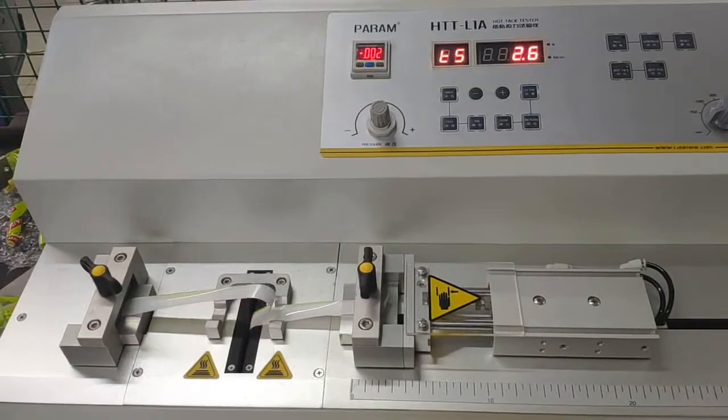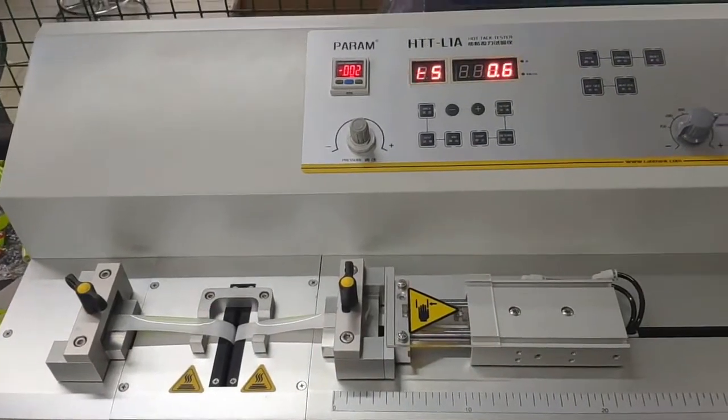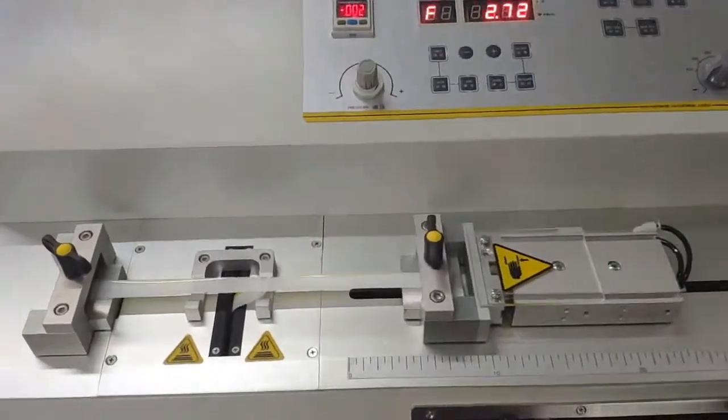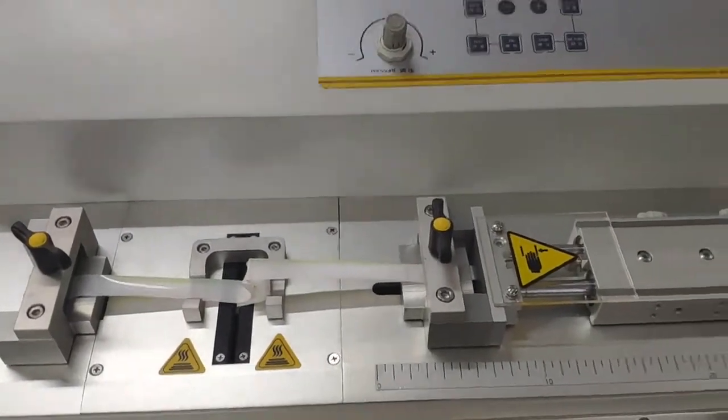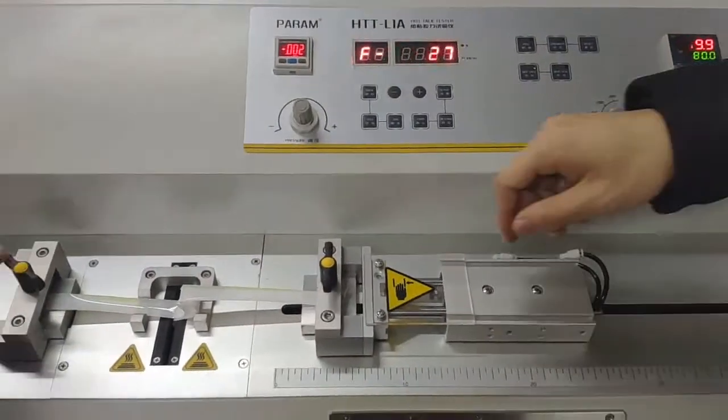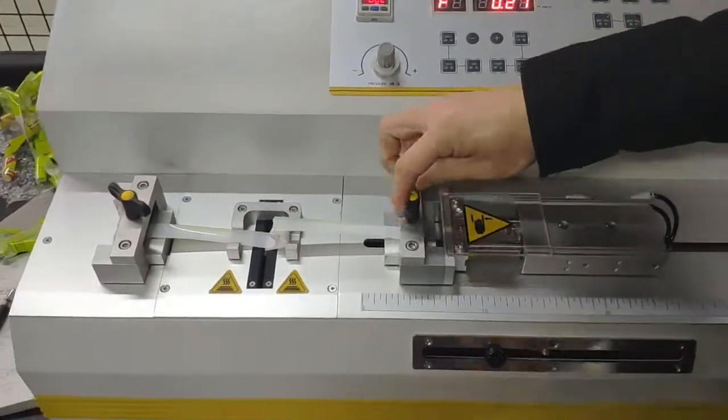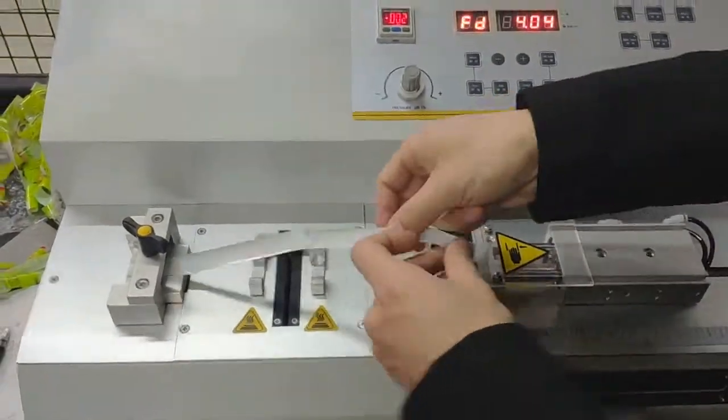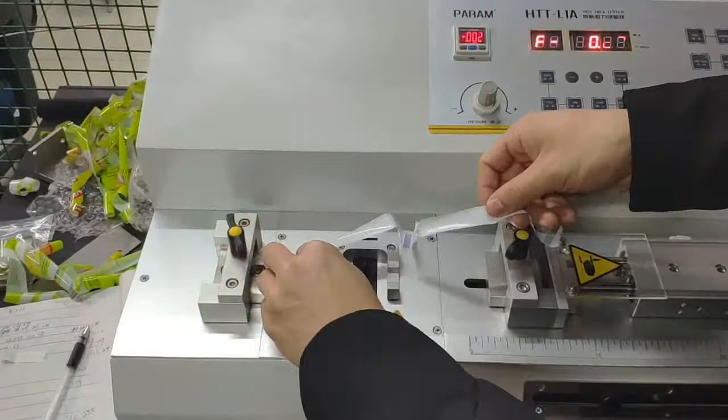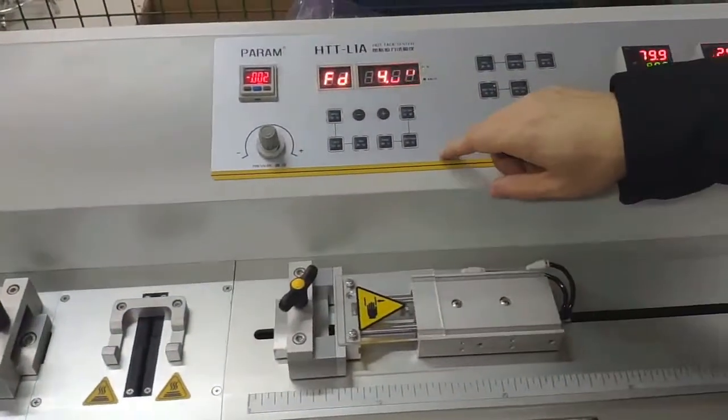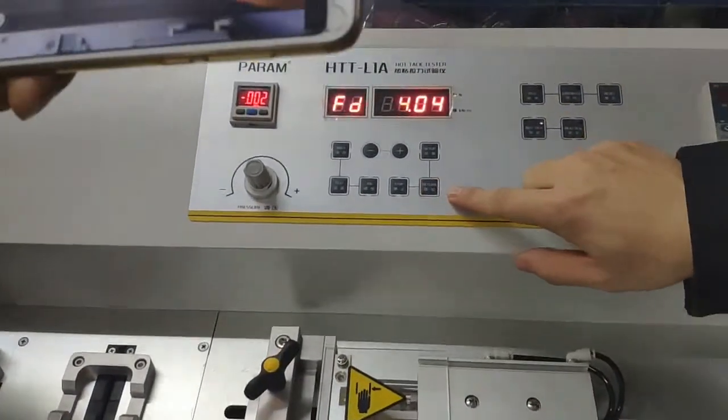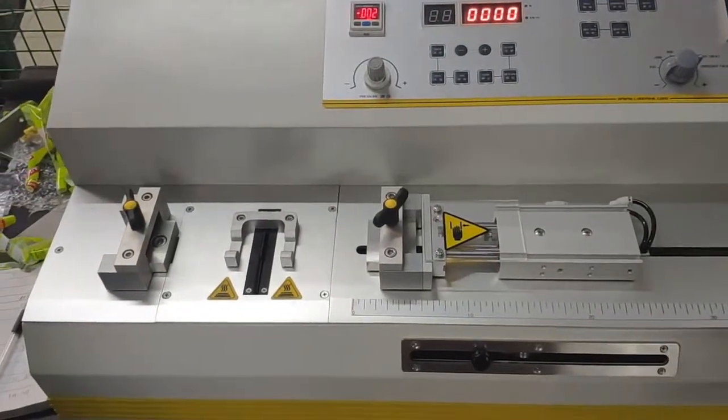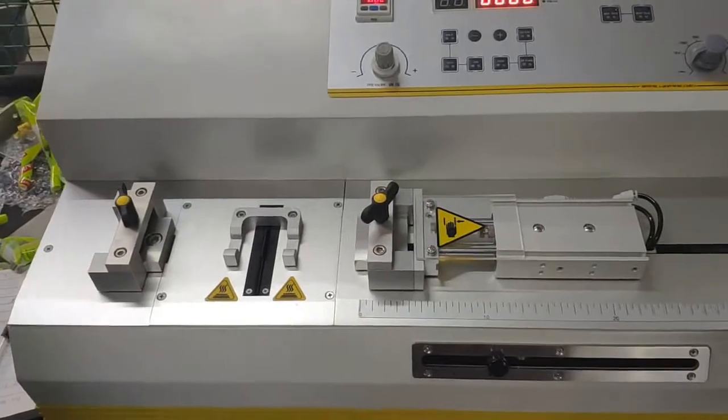Now start the test. Test finished. Remove the sample. Press return.